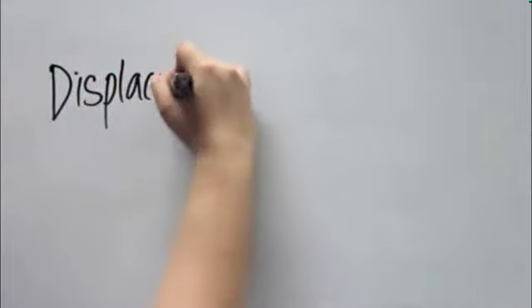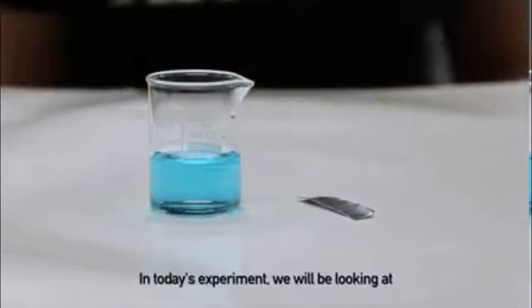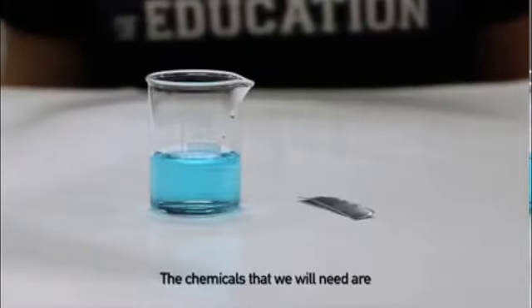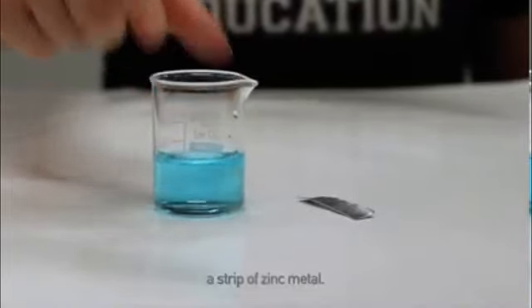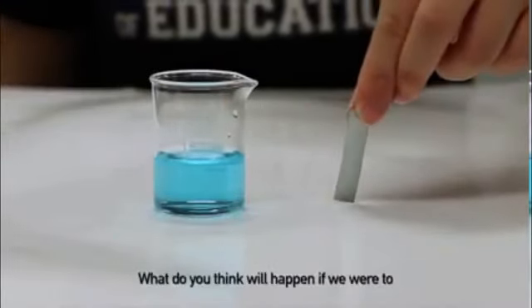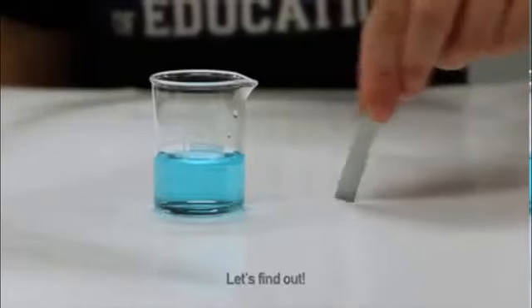Displacement of Metals. In today's class we will be looking at Displacement Reaction of Metals. The chemicals that we need are a beaker of copper sulphate solution as well as a strip of zinc metal. What do you think will happen if we were to place this piece of zinc into this solution? Let's find out.